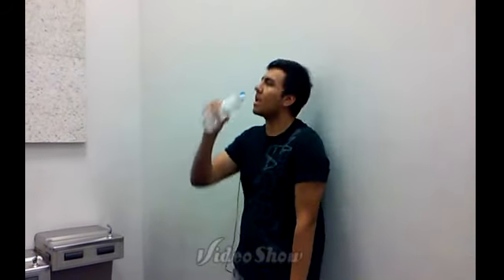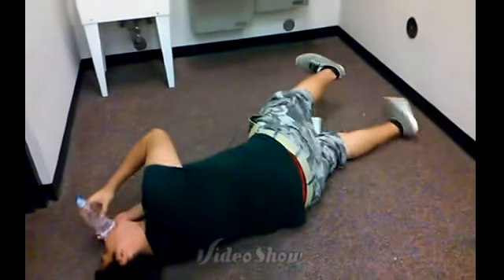And this is why you don't play in the lab. This is why you don't drink unusual chemicals in the lab. Yes, you're not wetting your hands. I know. What? You do it. Go for it. You do it. And this is why you don't touch open outlets with wet hands.